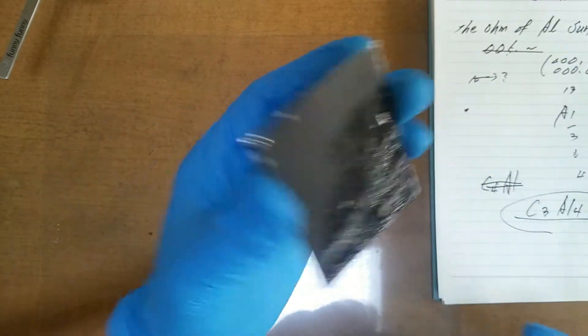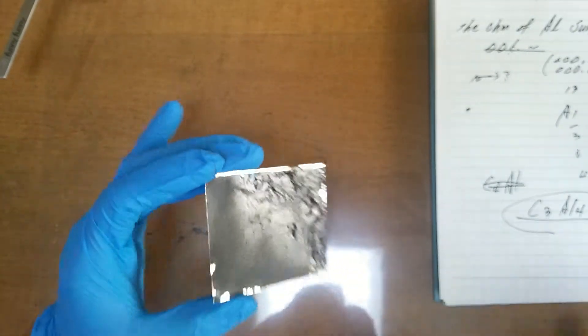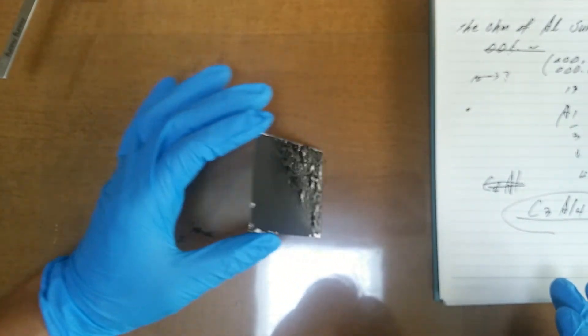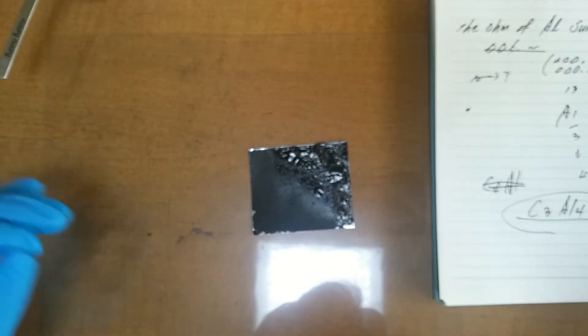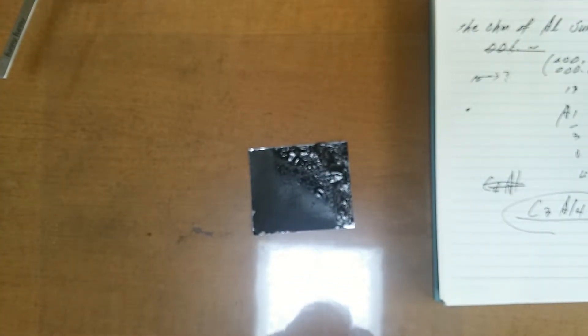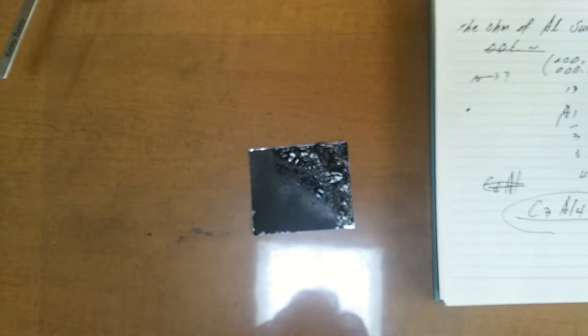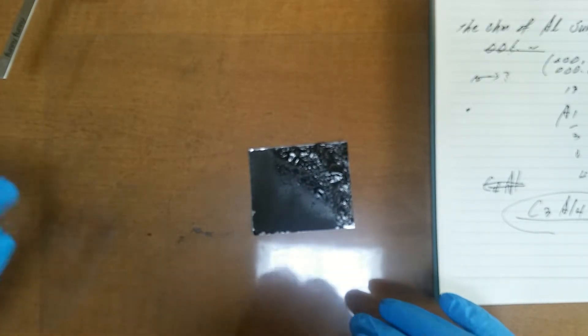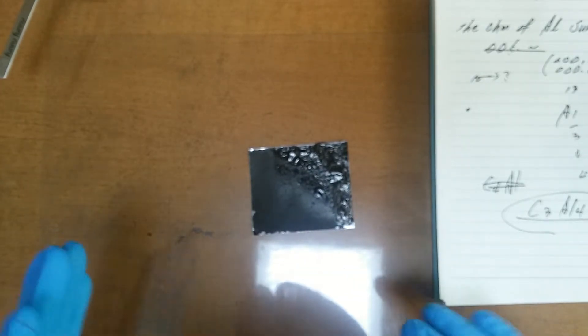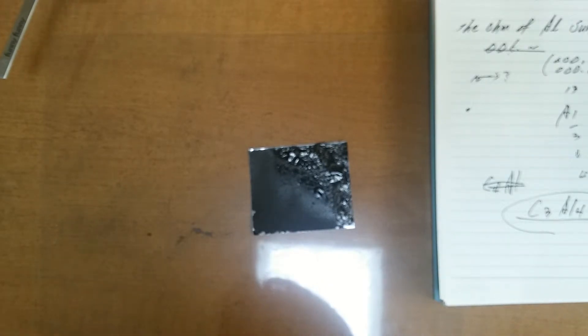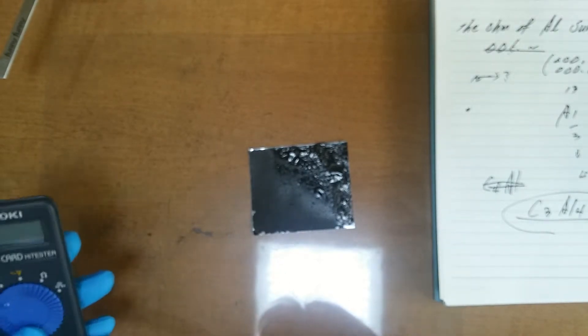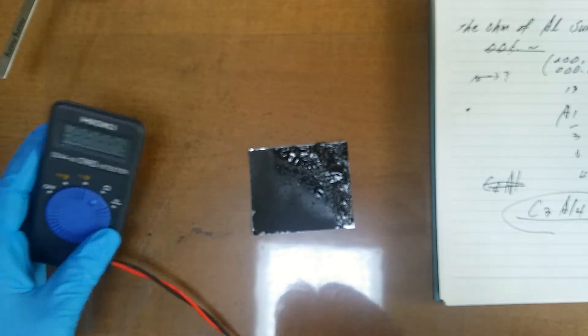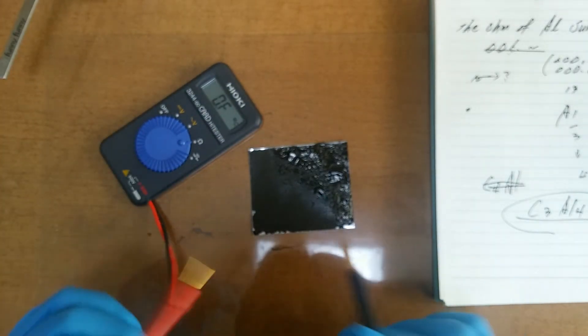I will make another experiment to make a better result. Frankly speaking, I have made this aluminum plate before, and it worked very well. But this time, maybe the surface was polluted by some oil, so the result is not good. By the way, this is science. Accept the failure. It's good.